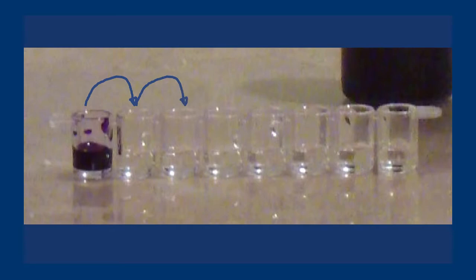Repeat this to transfer 10 microliters from well number 2 to well number 3 and mix. Then transfer 10 microliters from well number 3 to well number 4 and mix.